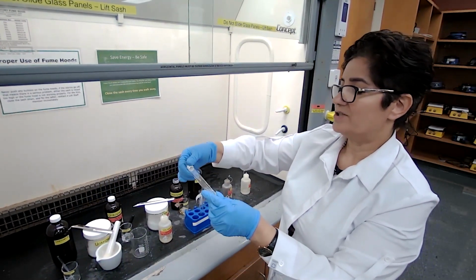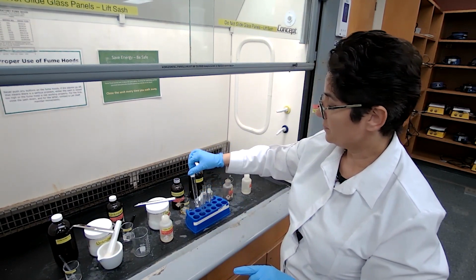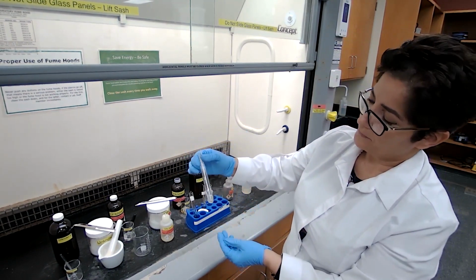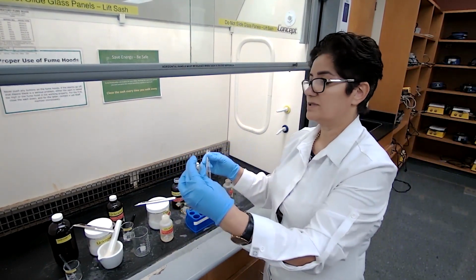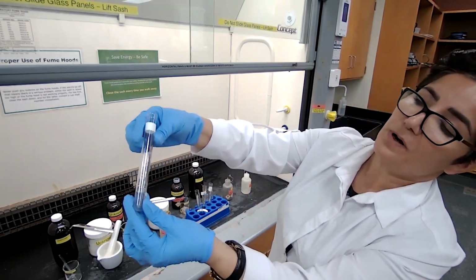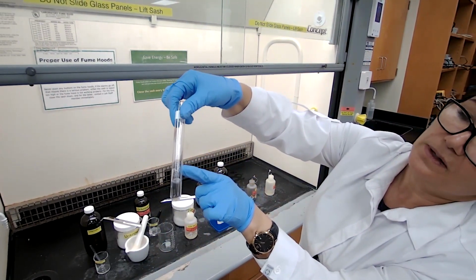Since this reaction is kind of fast, the silver has actually already formed. I'm going to leave it. That's unknown 5. Unknown 5 showed no reaction. That's how fast it was for unknown 6. The silver mirror formed on the wall of the test tube. This is for unknown 6. So it was a positive Tollens test for unknown 6, and the silver mirror formed here.